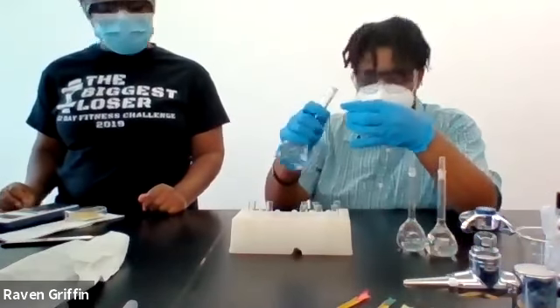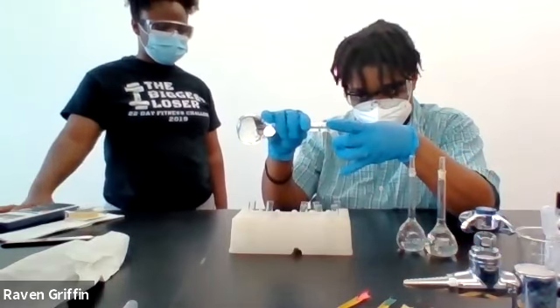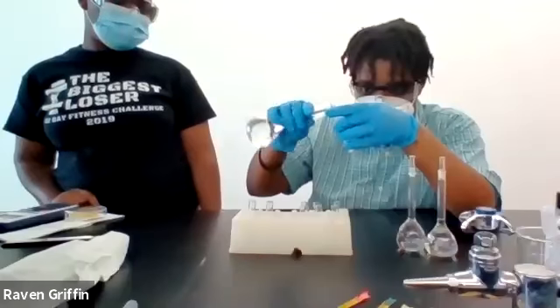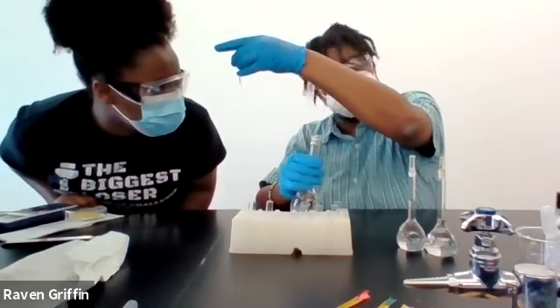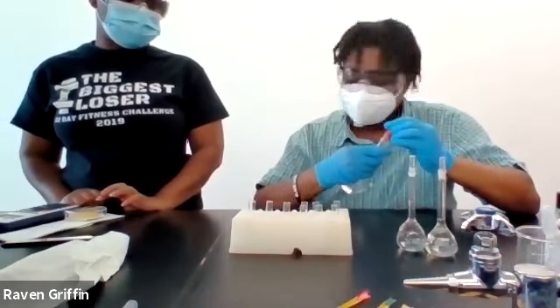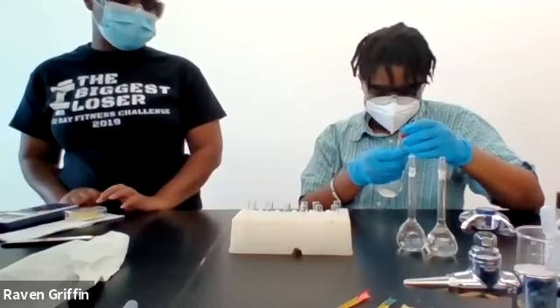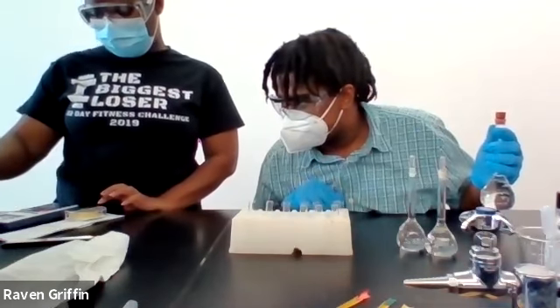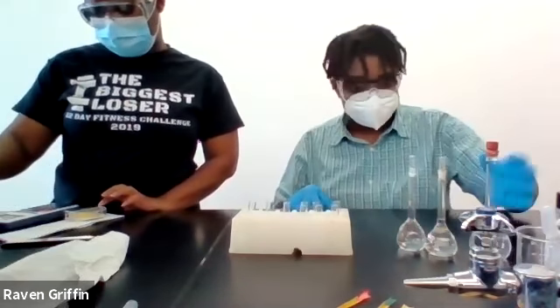So first is 3 molar. So nothing happened. How is that? Didn't we just get a reaction in the early part? Oh, well, the concentration's lower. So yeah, that's what makes the difference.